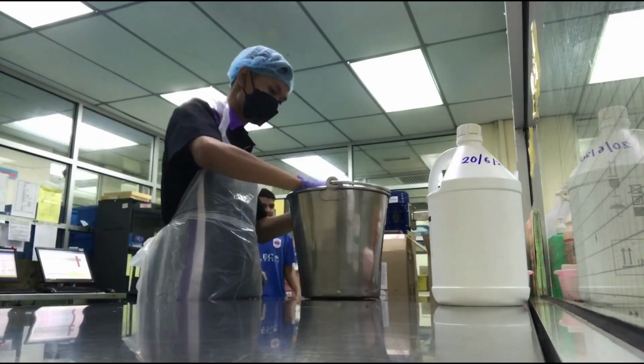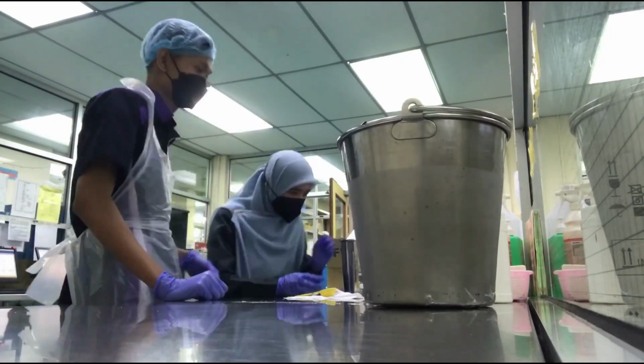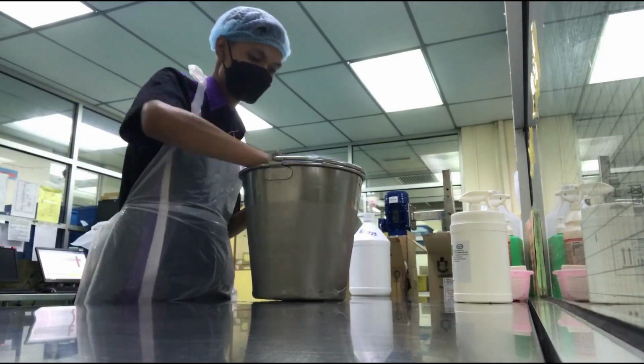In this video, I prepare potassium chloride mixture. Usually, potassium chloride mixture is used for someone who has potassium depletion.